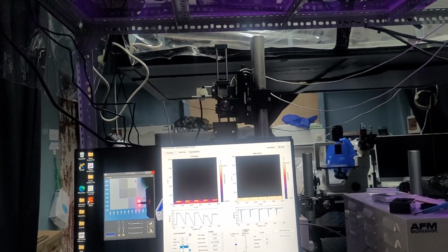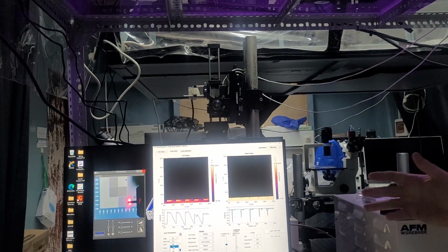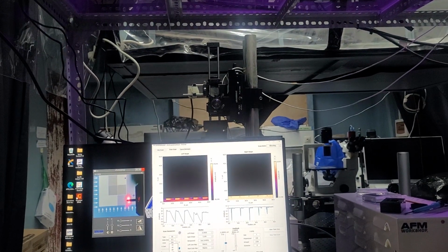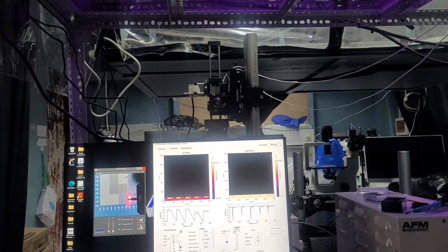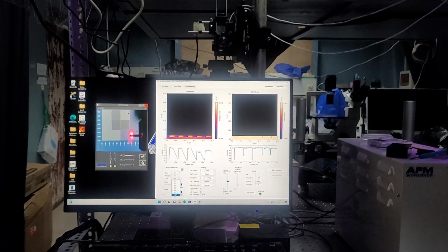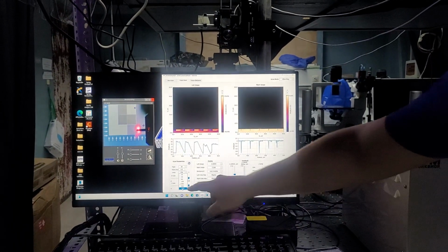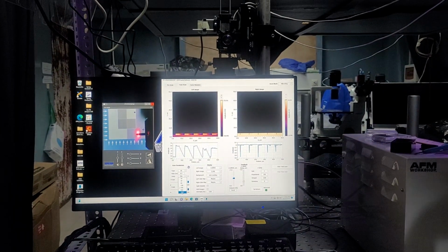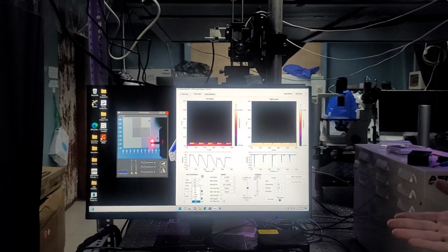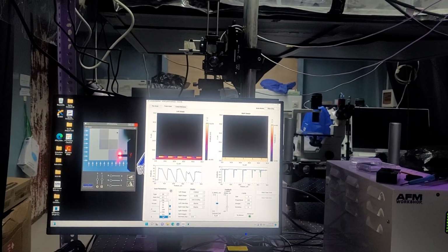It can go anywhere from 16 by 16, which over a 50 micron scan you're not really going to see much, all the way to a 1024 by 1024. I recommend sticking to 256 and 512. 1024, while the scans can look beautiful, it's going to take so much longer. Essentially, the difference between a 512 and a 256 is about 4 times longer. And the difference between a 512 and a 1024 is about 4 times longer.